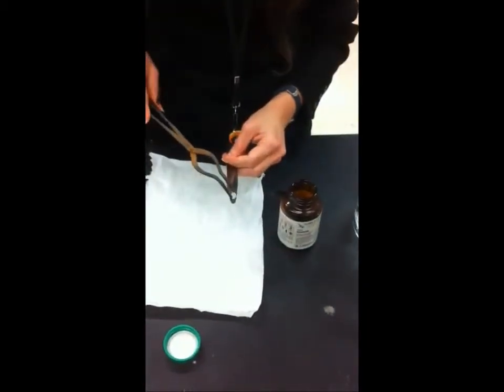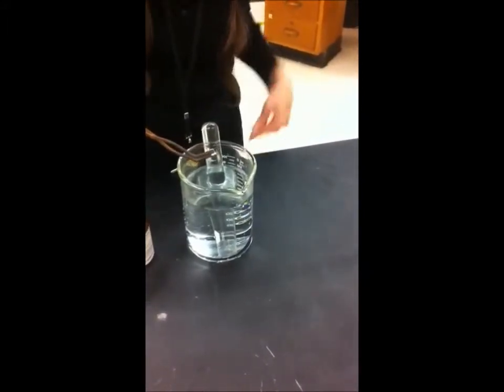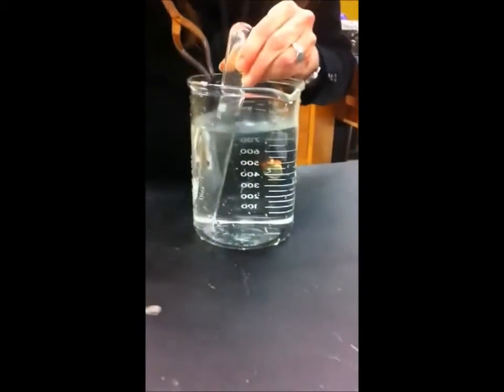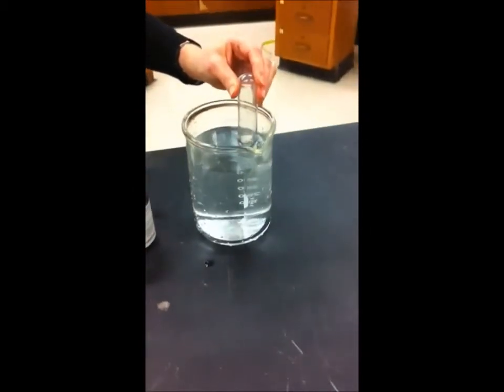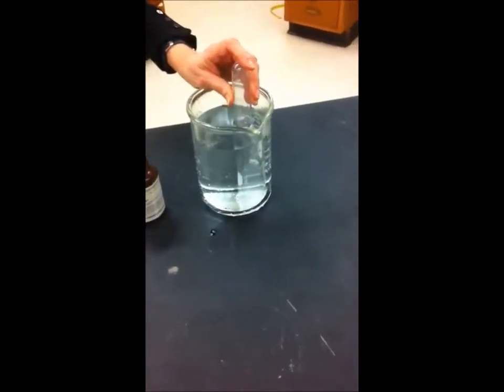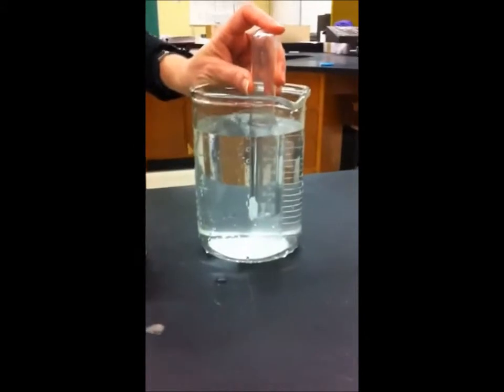Trial and error, I found that if I take a little pincher kind of thing, and you can see how malleable this is, I'm going to throw this in the water and capture it with the test tube. Here we go. Oh, crud. Okay, the sodium is burning in the water, and it's displacing the water in the test tube. And that little piece has just about used up all the water in that test tube.